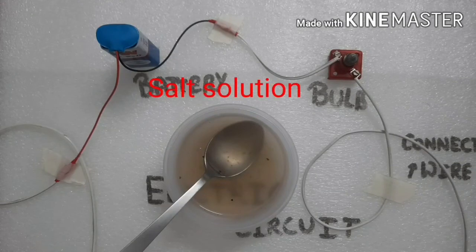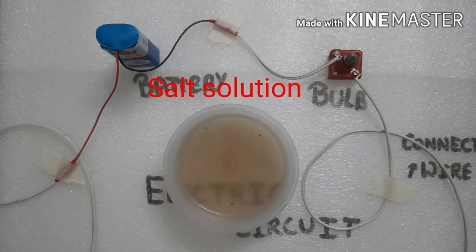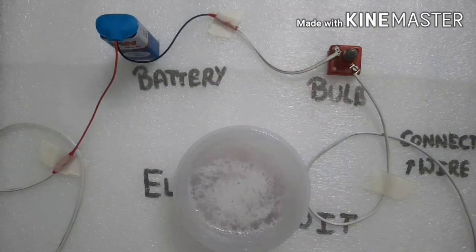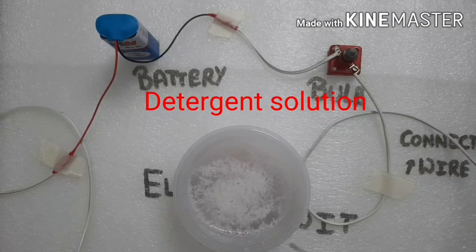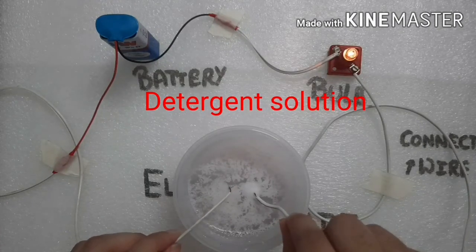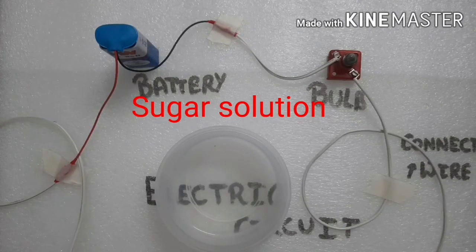Now we have salt solution with us. Let me mix the salt solution before putting the free ends of the wire into it. Now let us put the free ends of the wire into the salt solution. Next is the detergent solution — let us see what happens in this. Our next sample is sugar solution. Let us see what happens now.